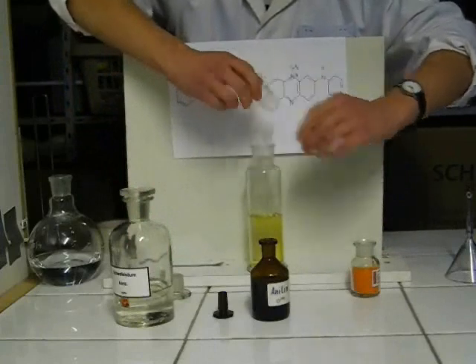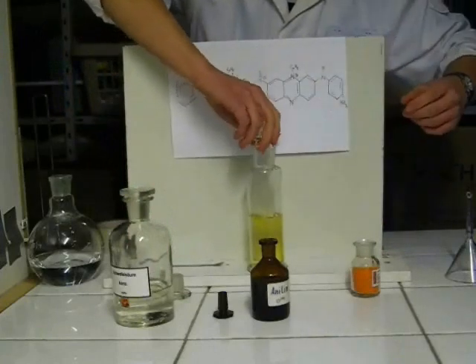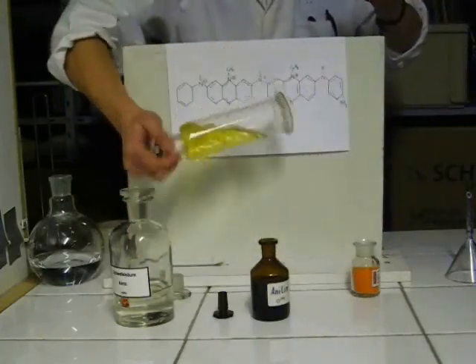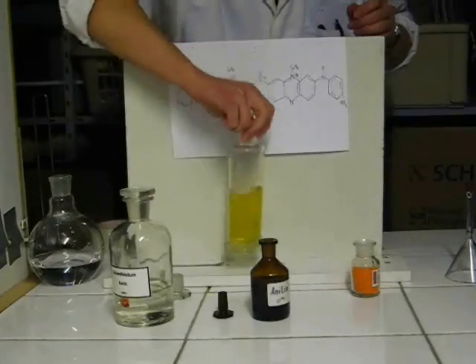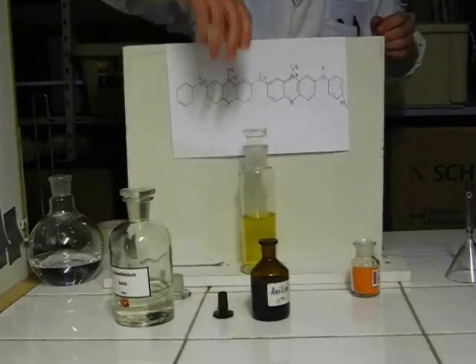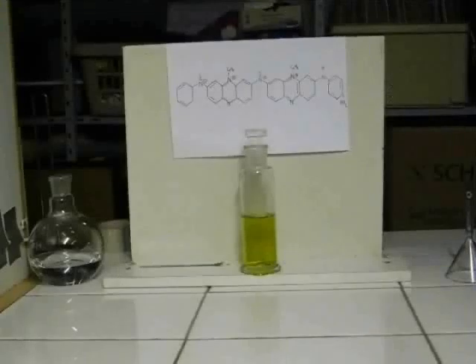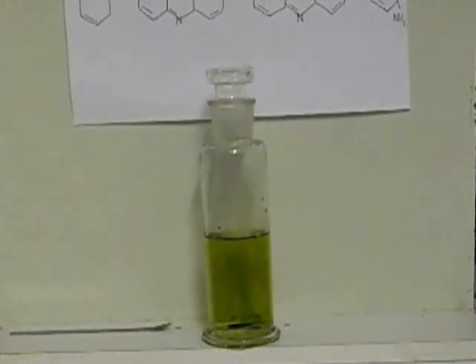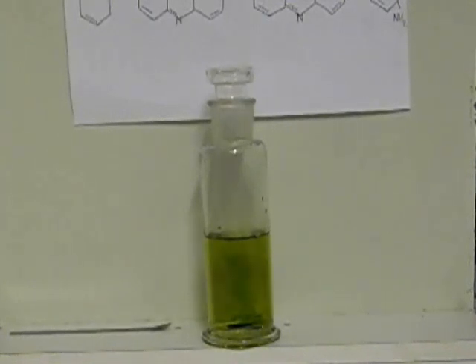Afterward, potassium dichromate is added and the mixture is shaken. The color changes from orange and green up to the aniline black.